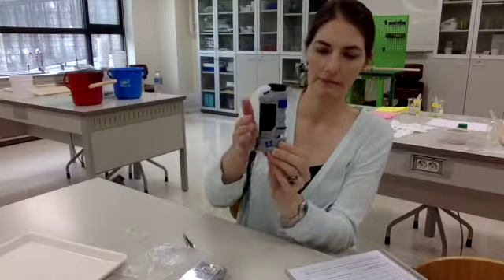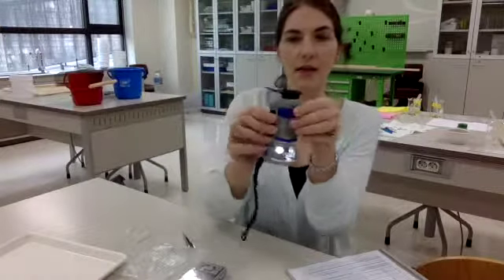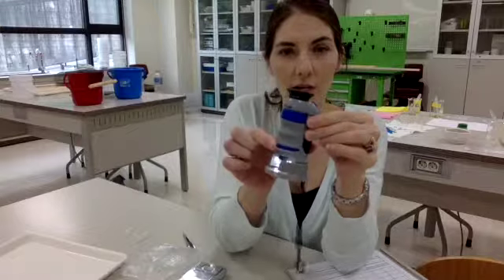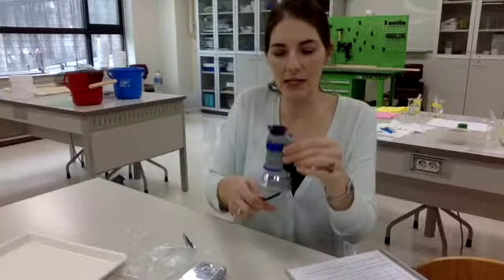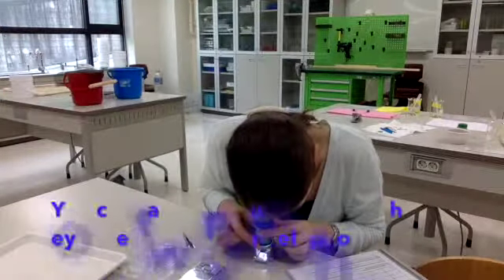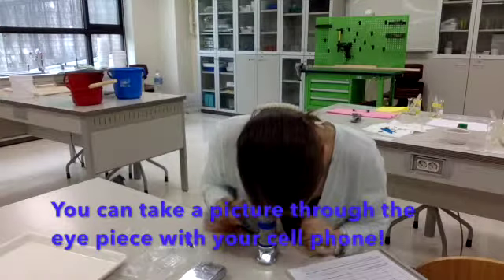Okay, sample back in. This button up here turns the light on, and then you can use this to bring it into focus. This would be like the rough adjustment, and this one up here would be like the fine adjustment, and you can actually look at your plastic like you're looking at a microscope. Wow. That is cool.